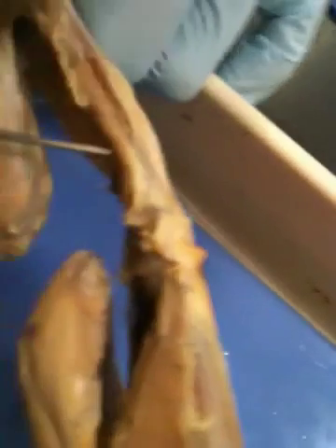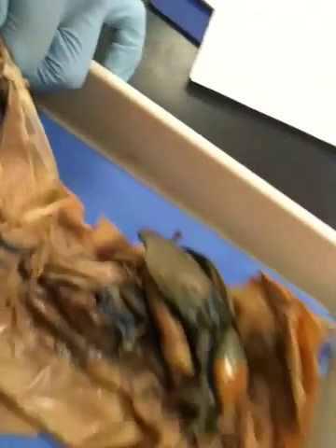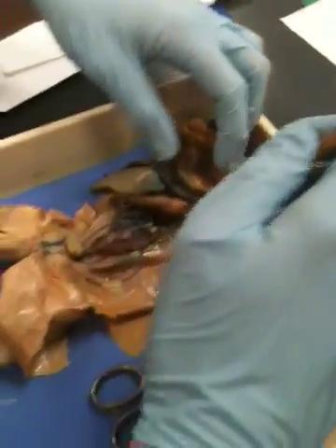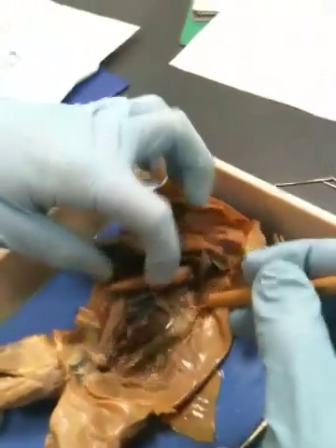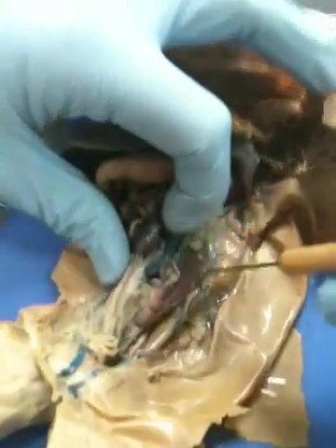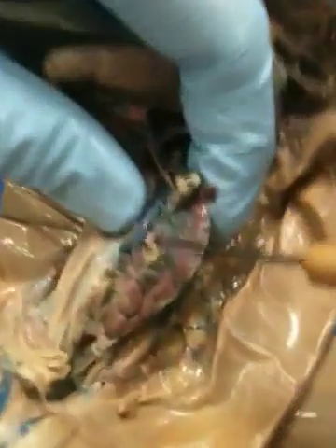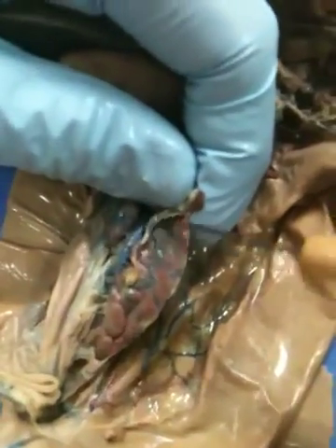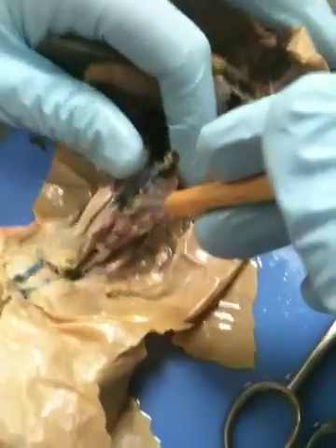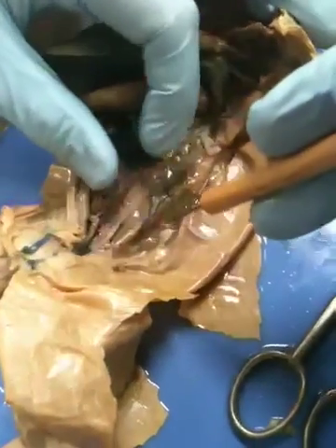Pretty small little thing. Never mind it. Yeah, right there. Okay. As far as veins go, here's the posterior vena cava, and it also has several different areas where it connects to the kidney, the renal portal veins, and from there it filters the blood, you know. Goes on down. What else do we have?